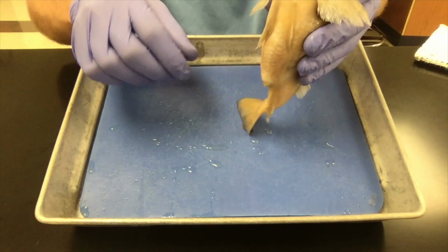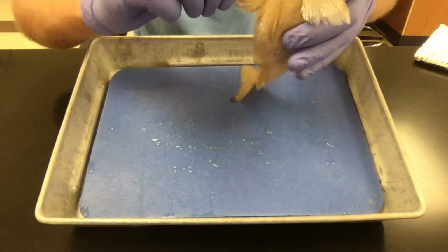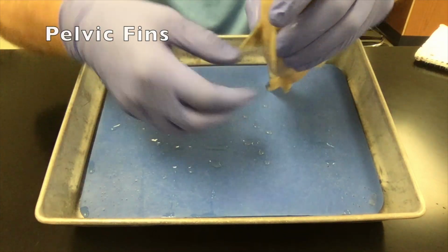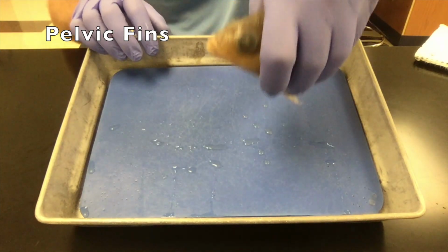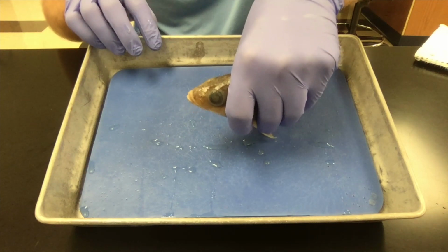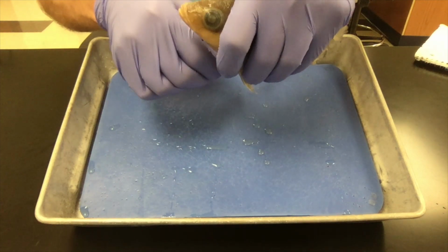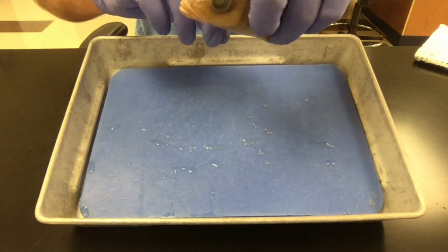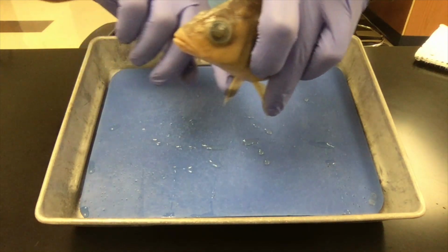On the bottom of the fish are 2 different types of fins. There's a set of fins called the pelvic fins. They have several functions. They help the fish to sort of post up on the bottom of the ocean or lake or wherever he's living. But they also help the fish to slow down. If he's swimming along, he wants to put on the brakes, he puts out those pelvic fins and slows down.